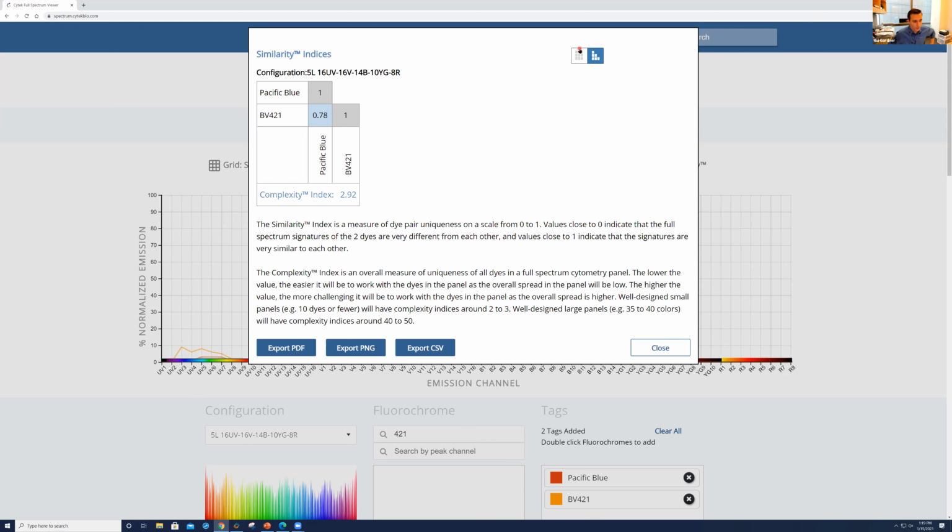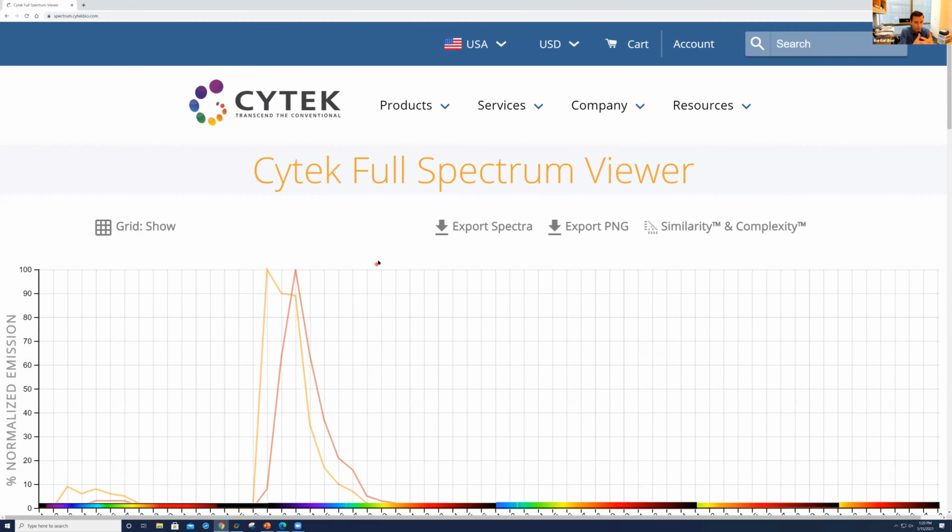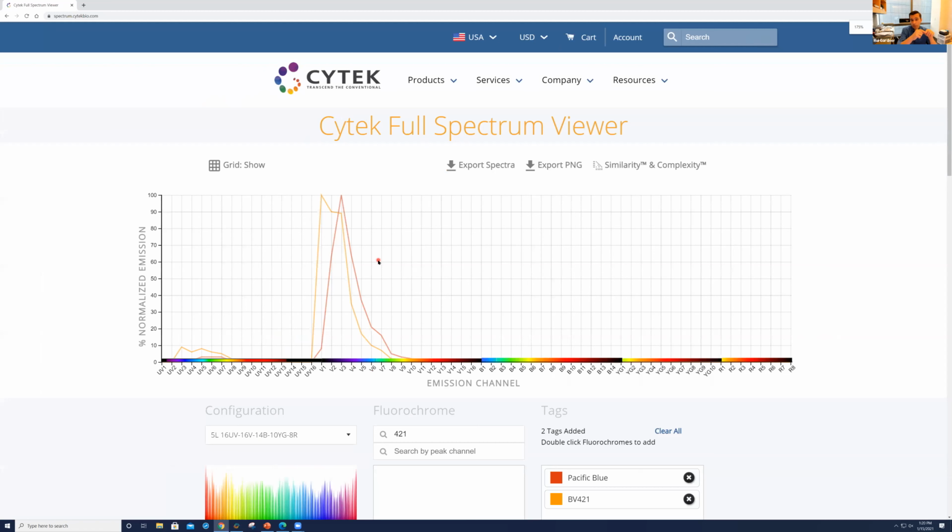Can I just comment something there also? So the big difference between this spectra viewer and most other spectra viewers is that it's displaying the intensity for the channels, and that's why you were mentioning, Kathy, that it's important for us to specify what's the configuration. Yep. So this spectra viewer is actually mimicking the detectors or the channels that the Aurora has, right? Whereas you could go to BD or Thermo Fisher or BioLegend and just ask to display the signature, the spectra, and see how much they overlap.